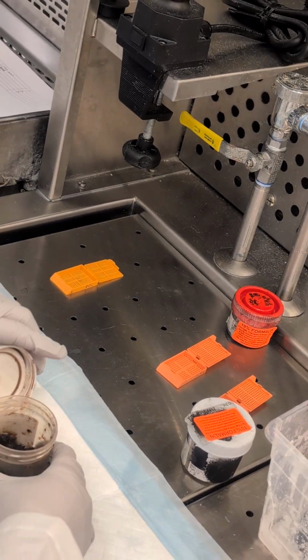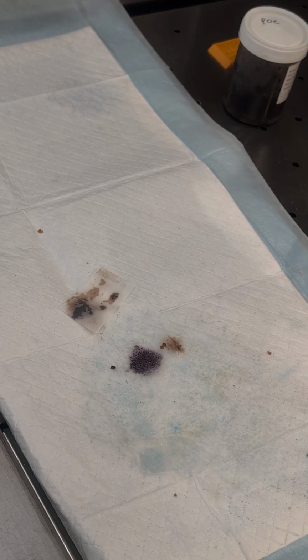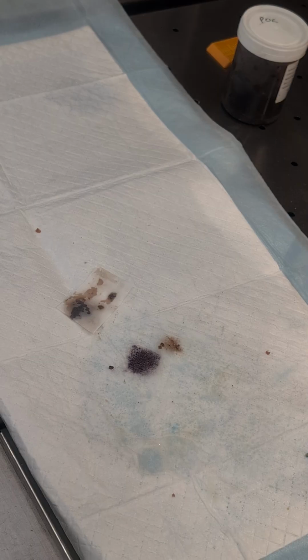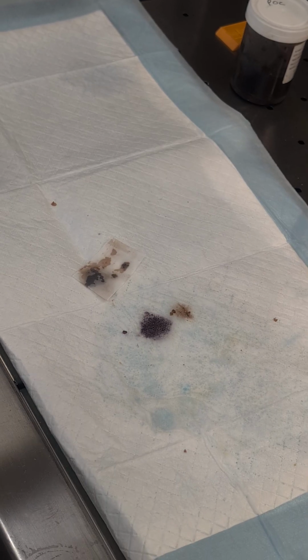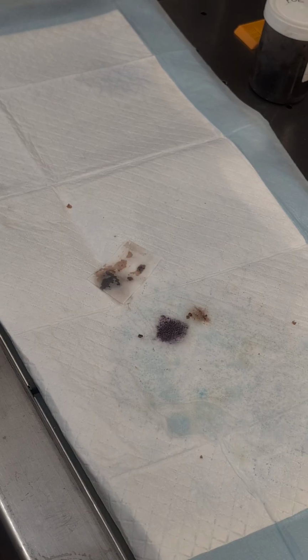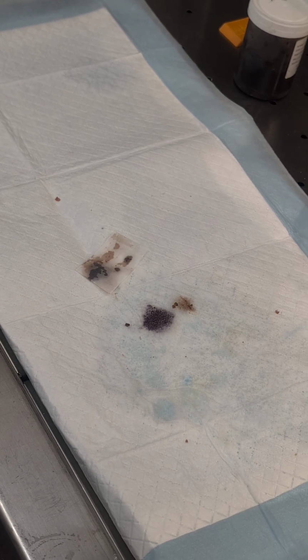But aggregates are going to be ones that you can't really keep all together, and that's okay because some tissue is going to be like that. For example, anything coming from the genitals, from anybody that has a cervix, you would expect to get aggregates like that too, and they're very, very tiny, and it's very hard to keep track of everything. It's labeled as an aggregate so everybody understands, maybe you don't see it on that first layer when you cut into it, but it might be further layers deeper. But you also might have lost it too.